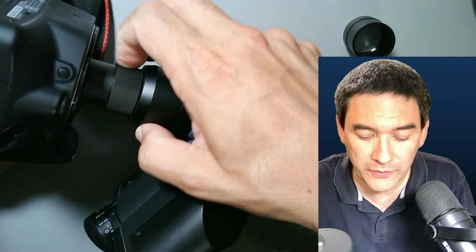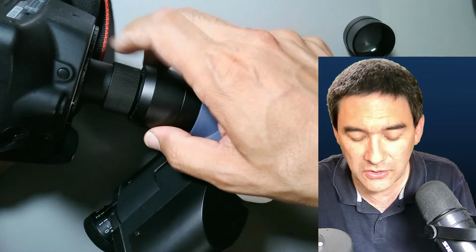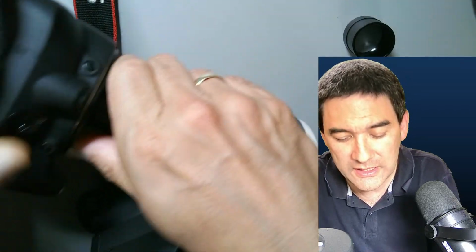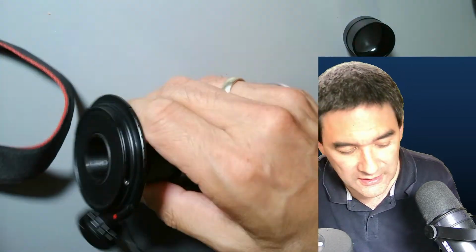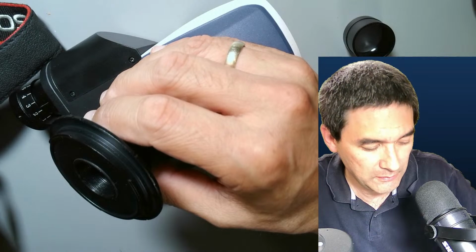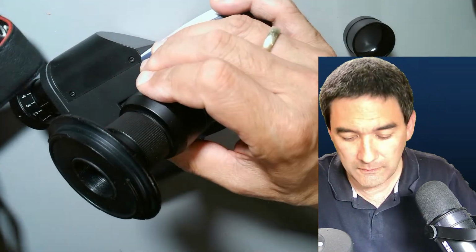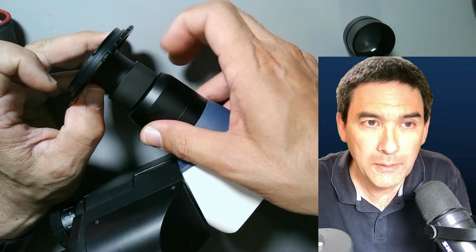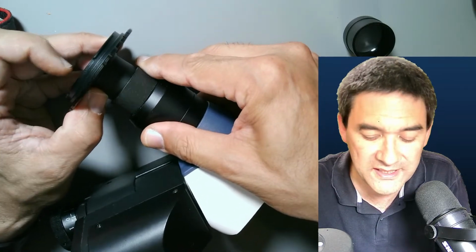And over here, there is a possibility to, and I have to disconnect this again to show you. Okay, there is a possibility to adjust the length. Let me put the alcohol here away. Yeah, there is a possibility here to adjust the length by rotating it out, and then by turning the other one, you kind of can fix it again into place.